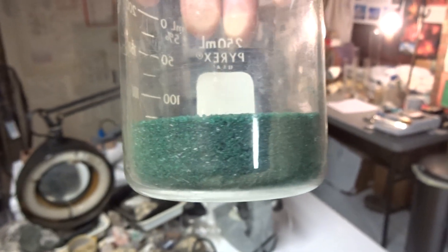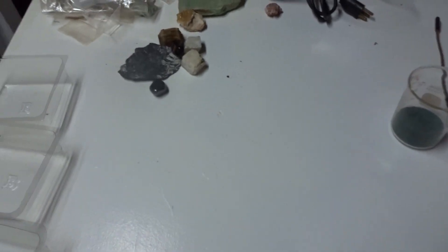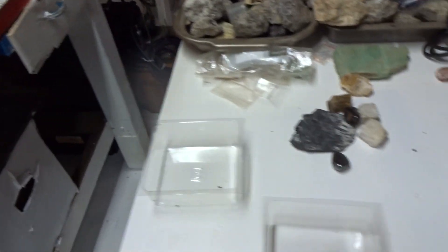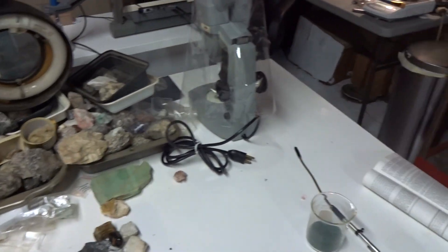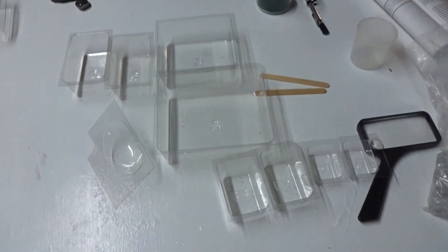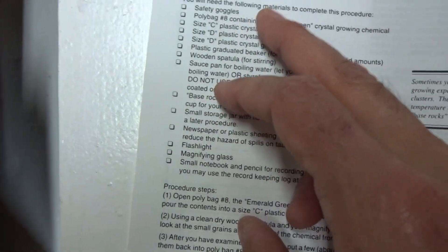These are our cups. Here is our zeolite chemical containing aluminum, silicon, oxygen, magnesium, and some calcium — a five-hydrate. I'd have to look up the exact name, but that's inconsequential considering there are 103 man-made zeolites and almost 40 zeolites found in nature naturally. Put your safety glasses on and make sure you're wearing gloves — that would be the safe way of doing it.